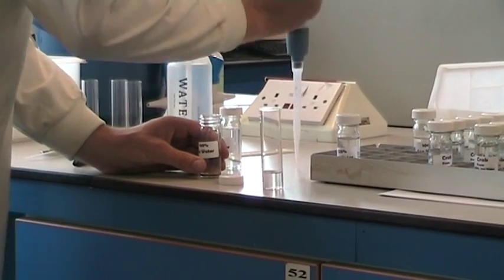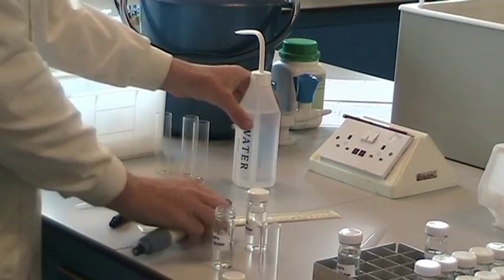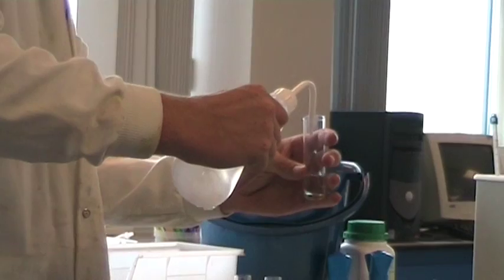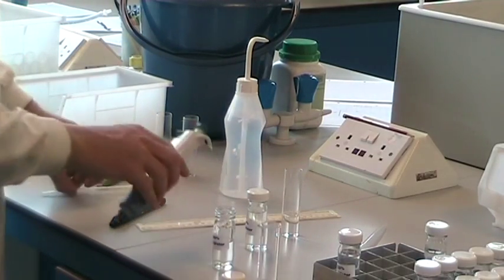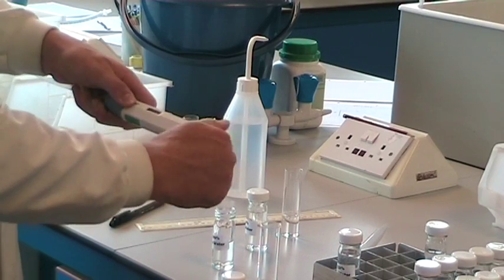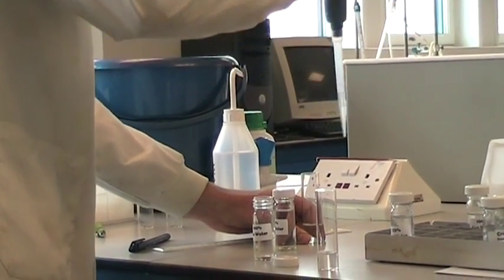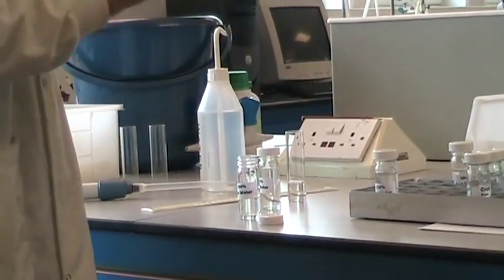Remove the pipette tip. To avoid contaminating your distilled water bottle, squirt some into a tube first. When using your marked pipette tip, you need to change the tip. Then you can use the standard dilution of 80%.